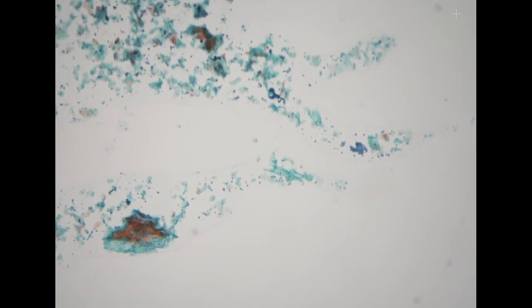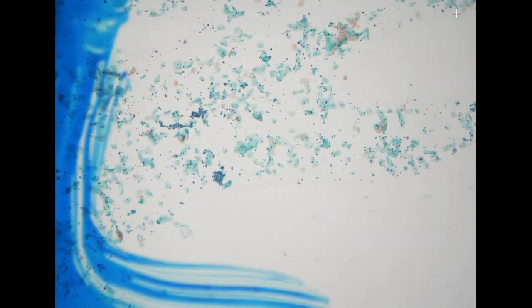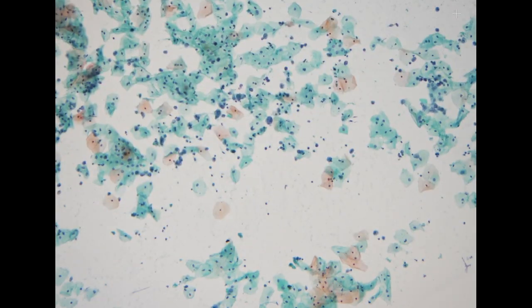The next specimen is relatively uncommon. It's a 74-year-old female who had a total hysterectomy for an unknown reason. So the patient has already had her uterus removed, and she has some symptoms, and a biopsy of the vagina suggests that she had a high-grade carcinoma, likely clear cell carcinoma.